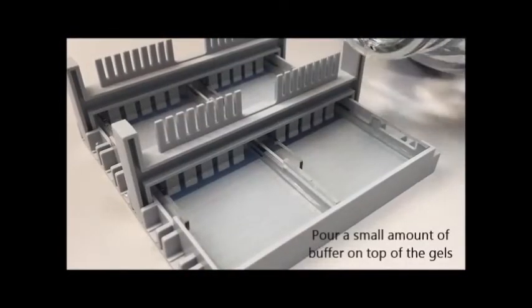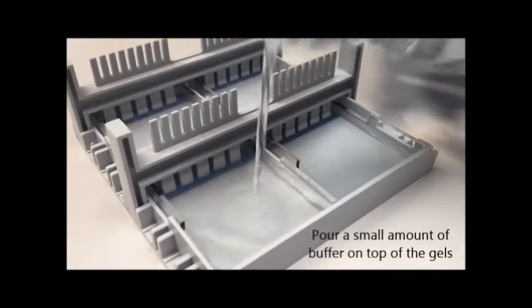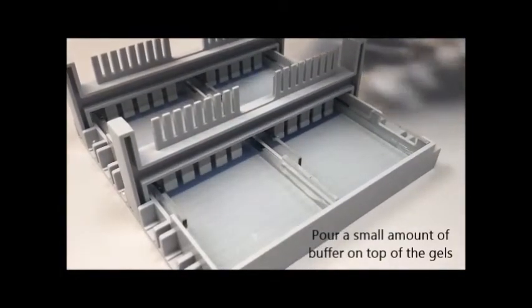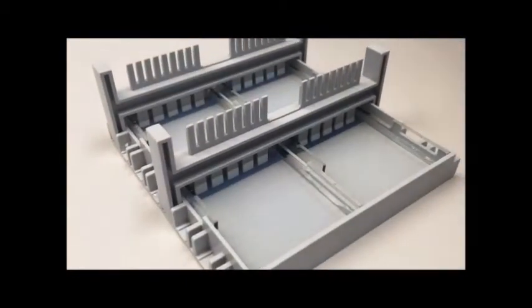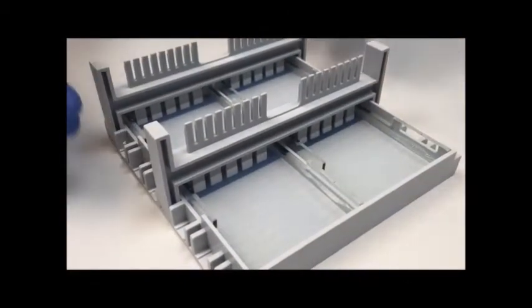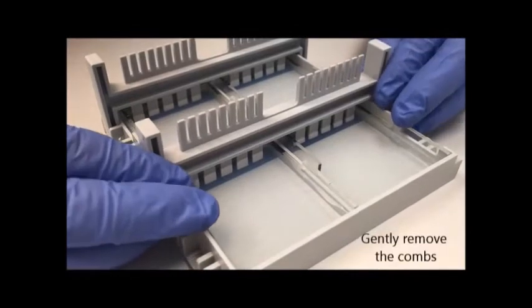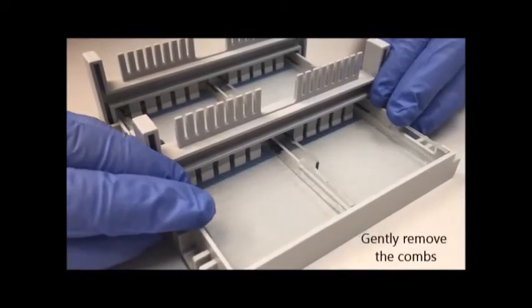Once the gels have solidified, it's time to remove the combs. First, pour a small amount of buffer on top of the gels. This will facilitate removal of the combs. Gently pull the combs straight up and out of the gel, being careful not to tear them.